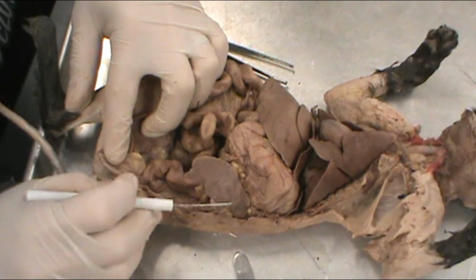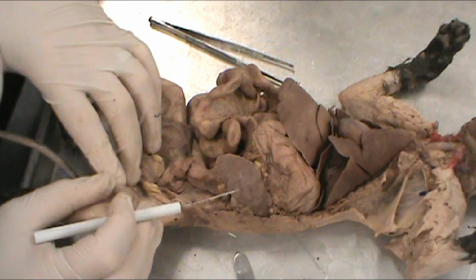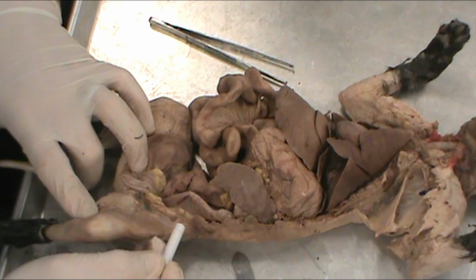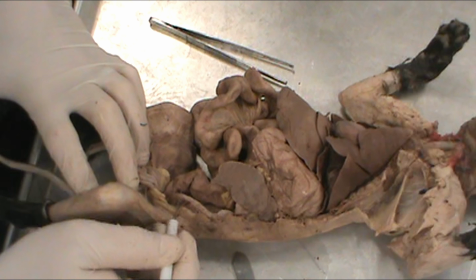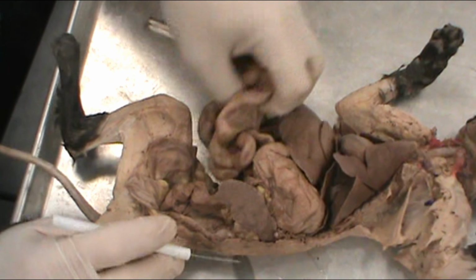This, as I mentioned earlier, is a little female. And we know it's a female as we look internally, we can see the uterus. So this little tube right here is one side. A cat has what's called a horned uterus because it forks kind of like horns on an antelope or a gazelle. So this is one side of the uterus coming up here to the ovary. And then this little tube over here is the other side of the uterus. So the presence of a uterus is a dead giveaway that this is a female.